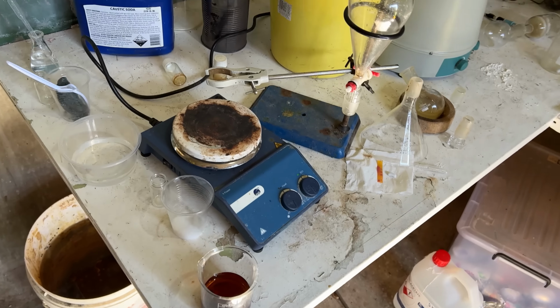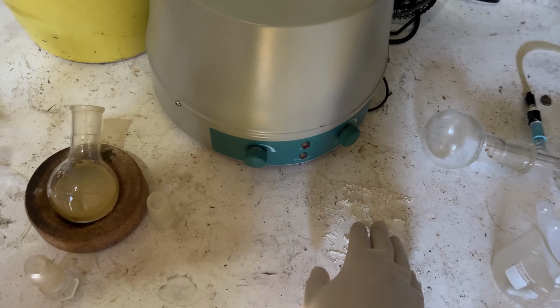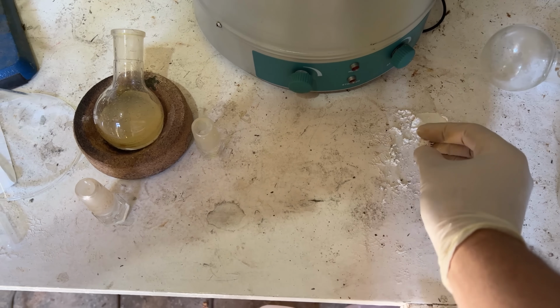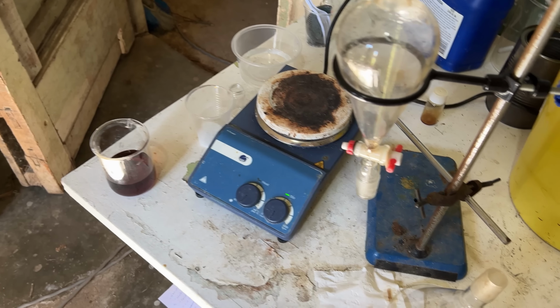But all going well, except for the part where I spilled the ethyl acetate a little bit on the table here. A bit sloppy. I'm a professional.